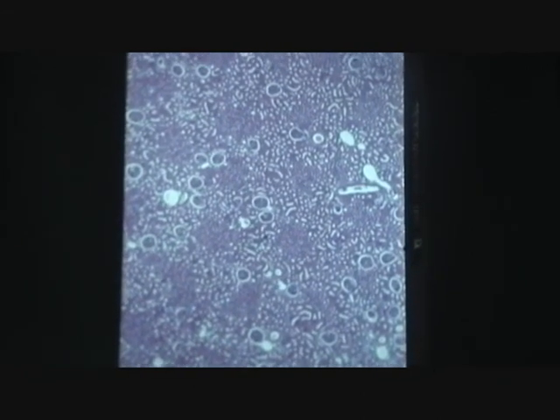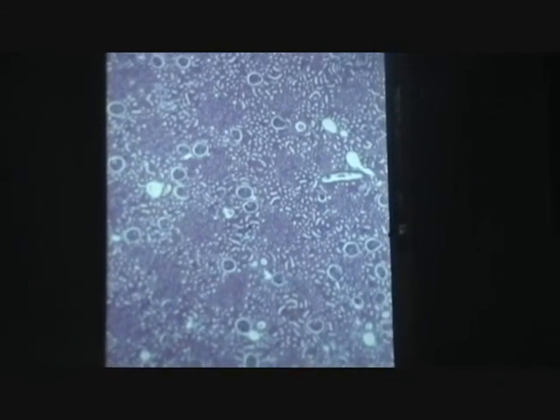All right, never saw this before. Can you tell where it's from? Let's say for next week, histology, you're thinking renal, endocrine, or male repro. We have those three histological areas to organize. You look at this and you say, is that renal, endocrine, or something to do with male repro? What do you think?